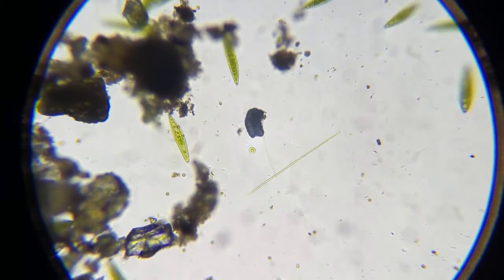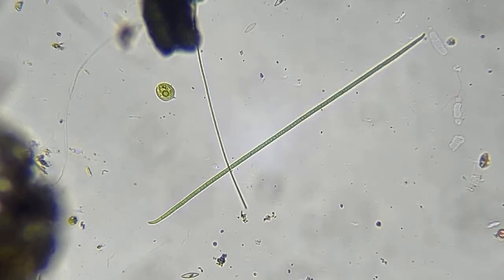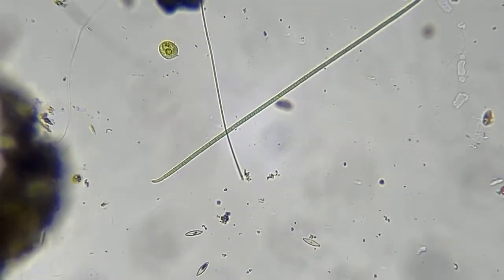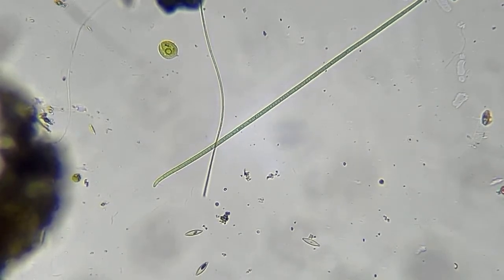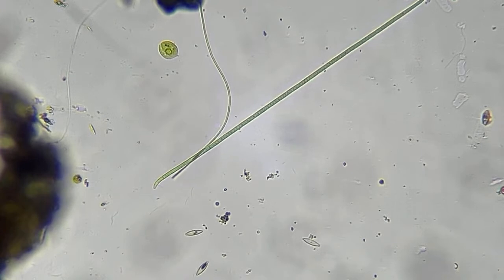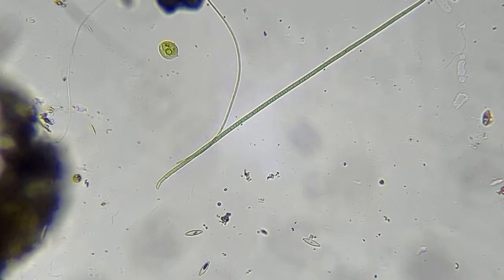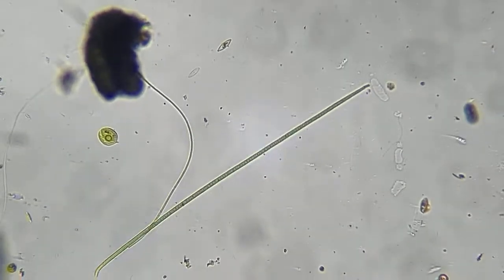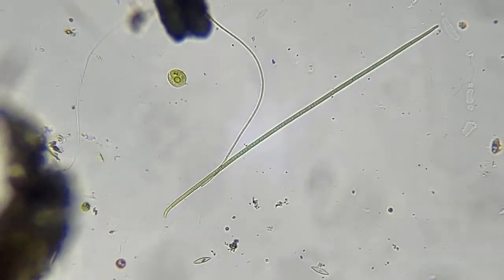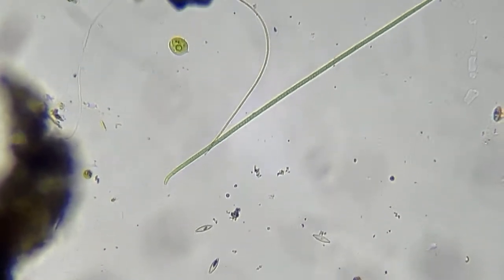And this is just another piece of algae here. Very, very small. This is cyanobacteria moving. See how it moves? It's actually an algae also that can move around. This is bacteria that acquired the ability to produce oxygen from chlorophyll. I might be a little off on that, but that's what it is. These guys right here are responsible for why all life today is on Earth and why we all breathe oxygen right here.